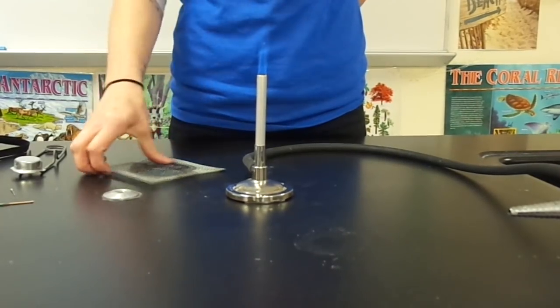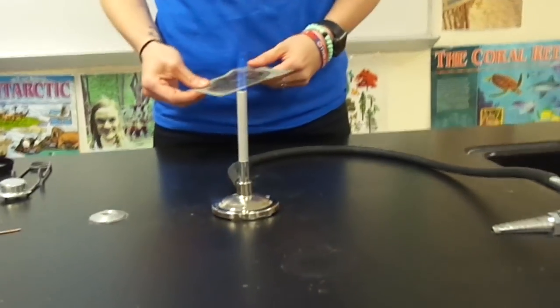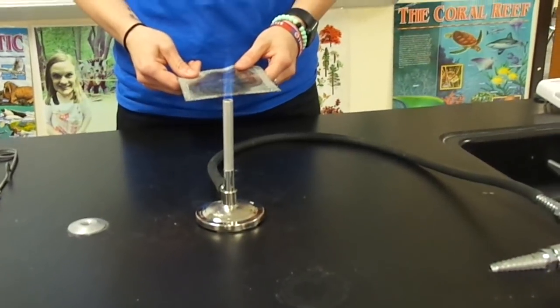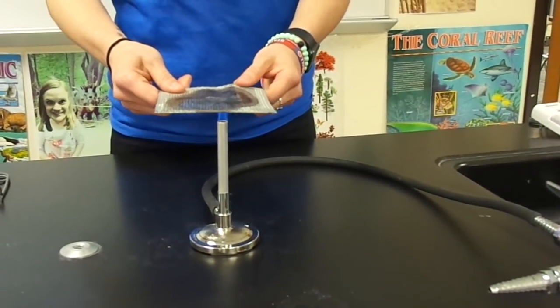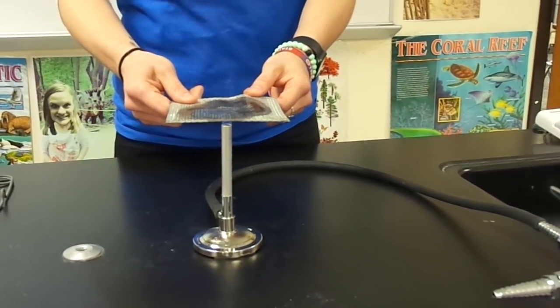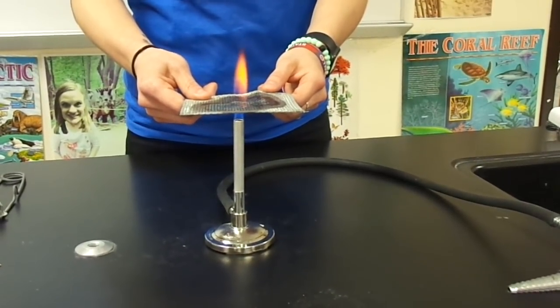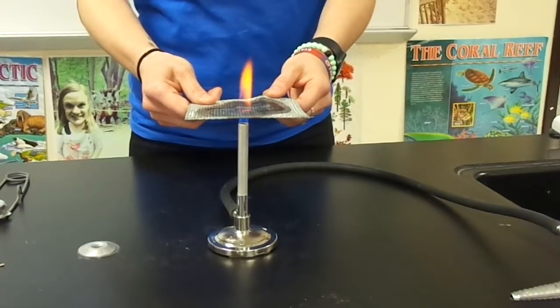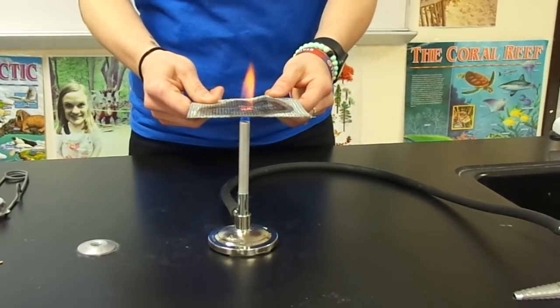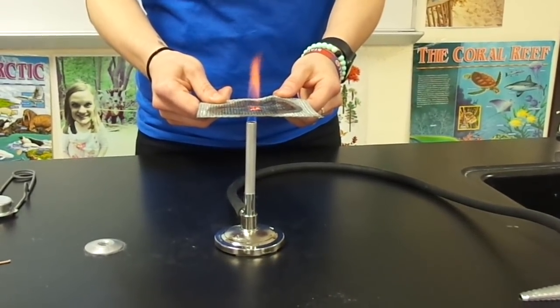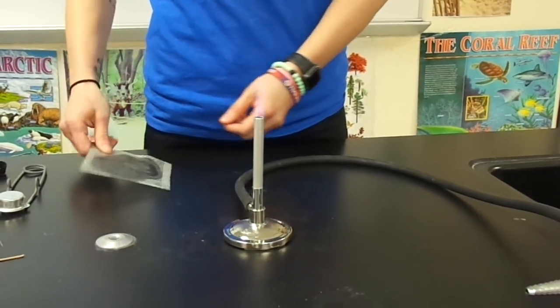Now you're going to take a piece of wire gauze and place it in the portion of the flame just below the tip of the light blue cone. You may need to hold your gauze over the flame for a few moments. Once you see a shape or pattern you're going to record it on your lab worksheet and turn off your gas one more time.